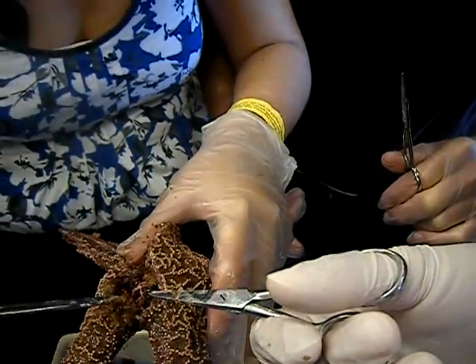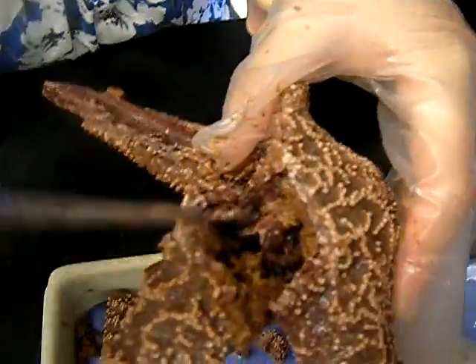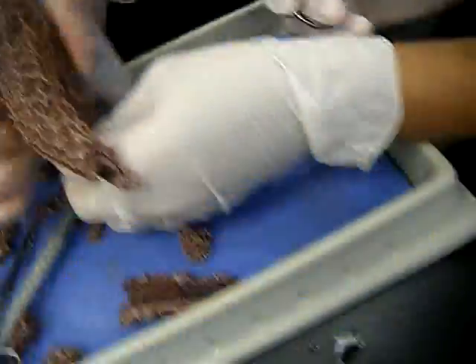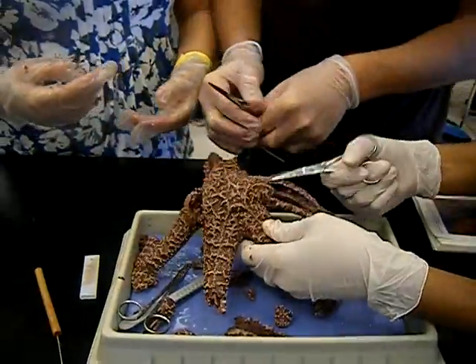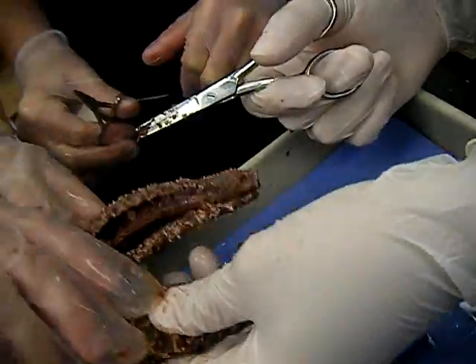Dig them out. Maybe we'll get extra credit. That's disgusting, Jimmy. They're right there. Can you see them? I like ripped this thing like a pork chop. Cut it right here. Let me see. Oh, look at this. Rip the whole thing, Amy. Here you go. That's your job.